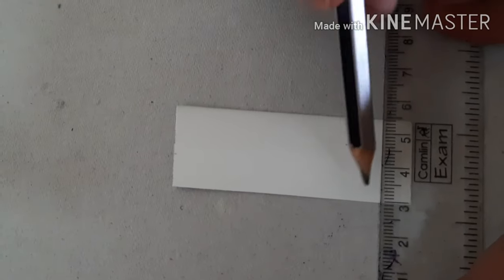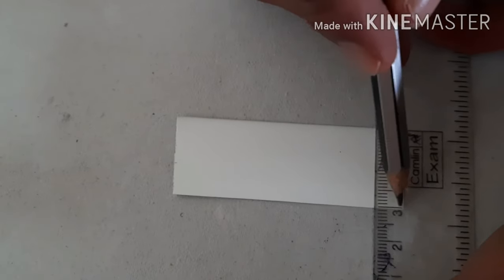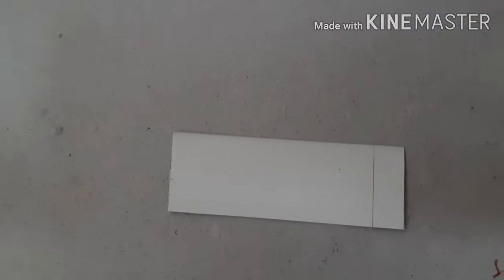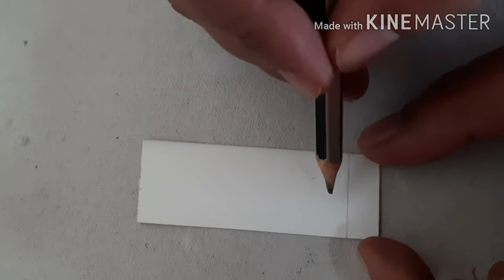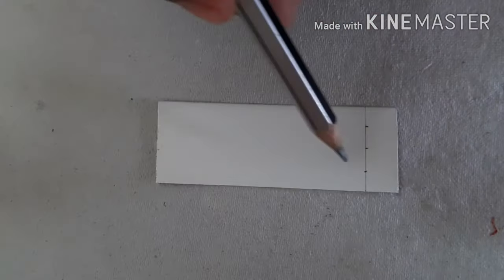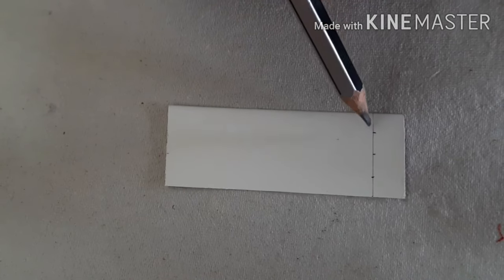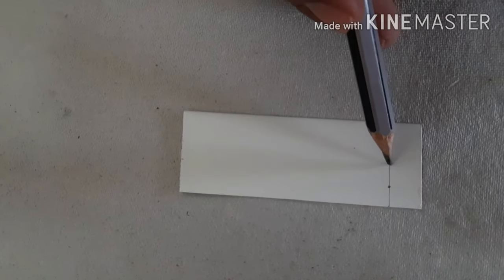We keep the beaker aside for at least 10 minutes for chamber saturation. Now we take the scale and pencil and draw the starting line or baseline on the TLC plate. We measure approximately 1 to 1.5 centimeters from the bottom and gently draw the baseline, being careful not to disturb the silica layer. Since we are spotting one sample and two reference standards, we mark three points on the baseline for spotting.